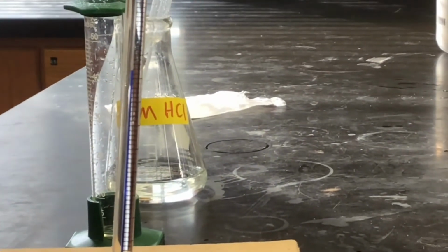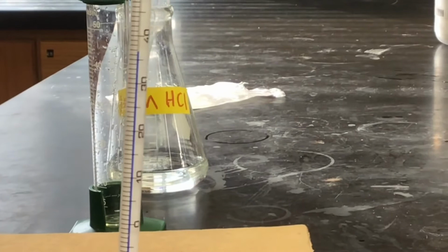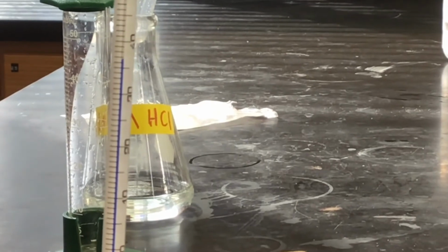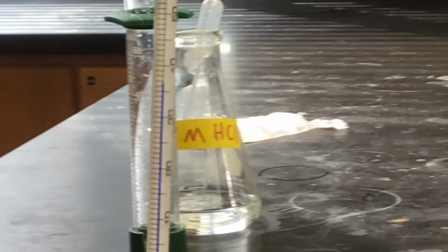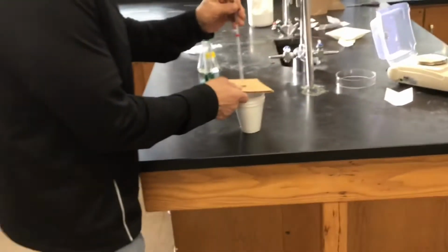Ooh, if you could just turn it back toward you. Can you hang on to it? Just give it a roll. Okay, right there is good. We can see that. There's our final temperature for this trial. We're gonna try to hold it still. Can you see those whole numbers? Okay. Okay, reaction number 1.